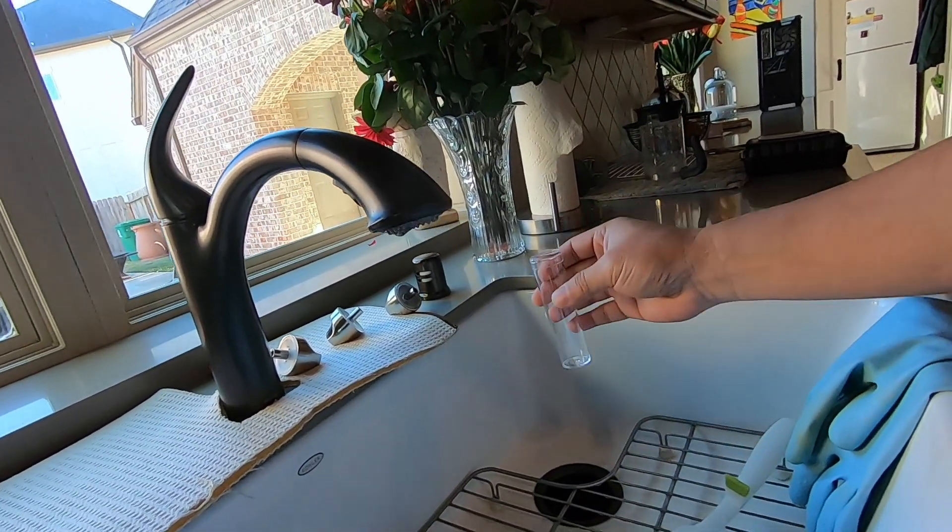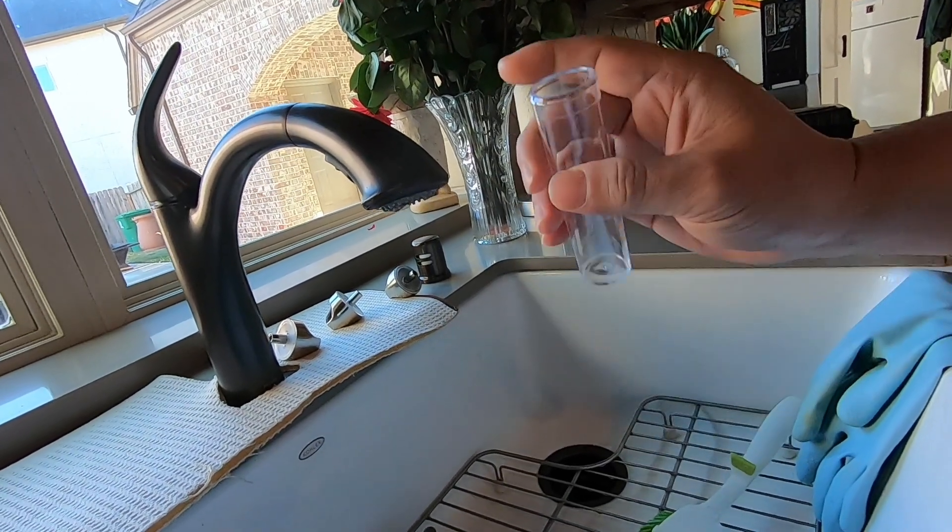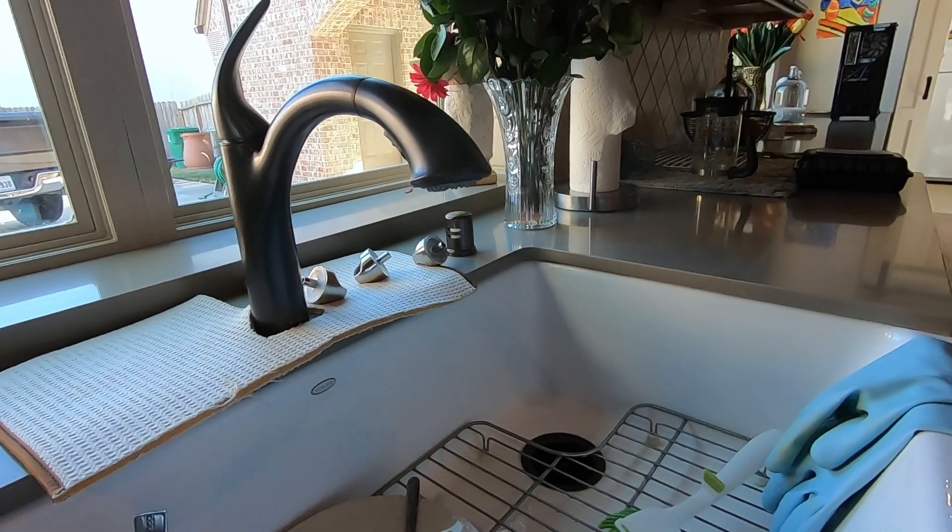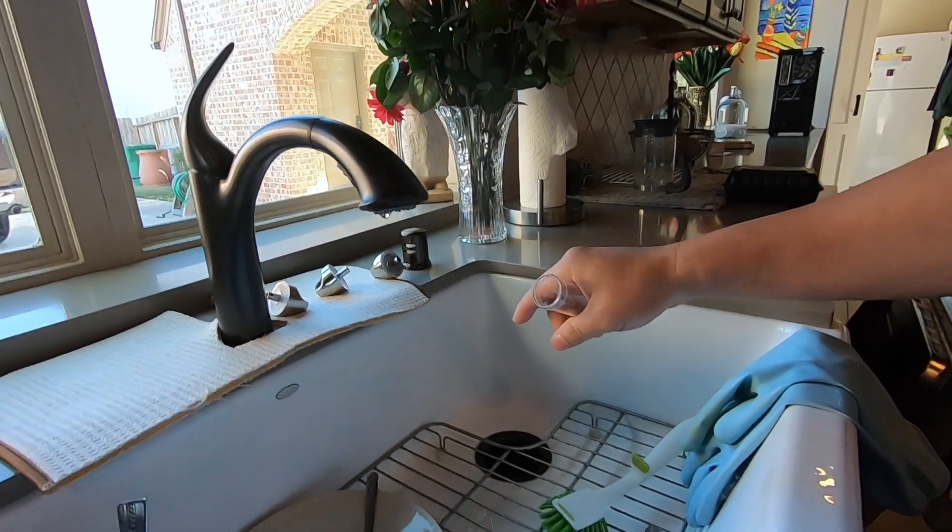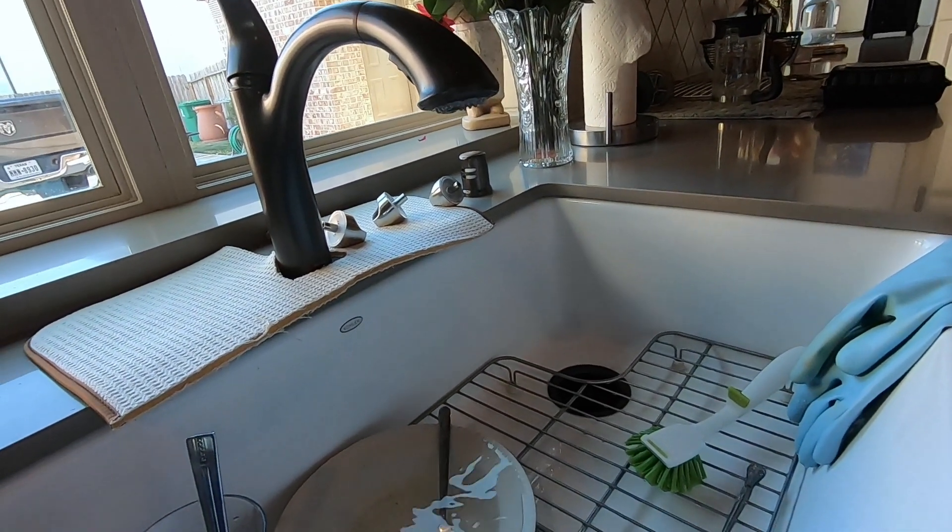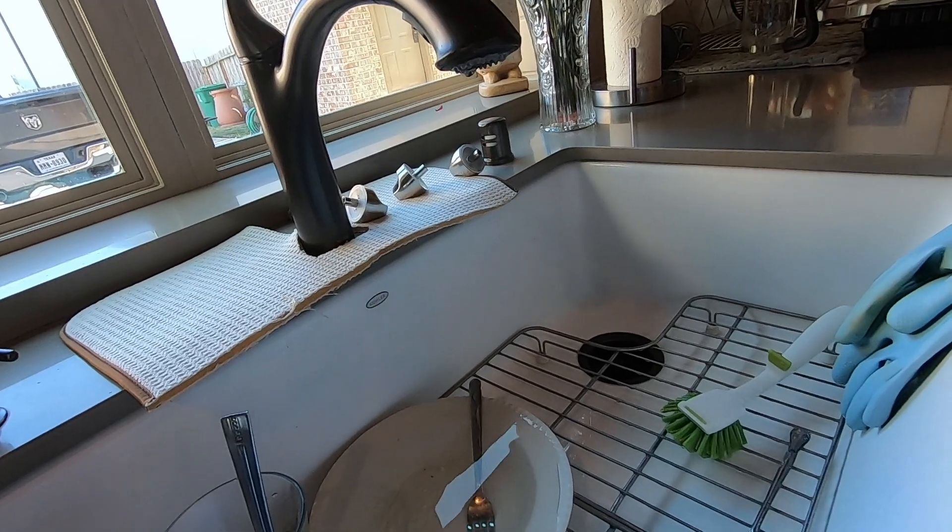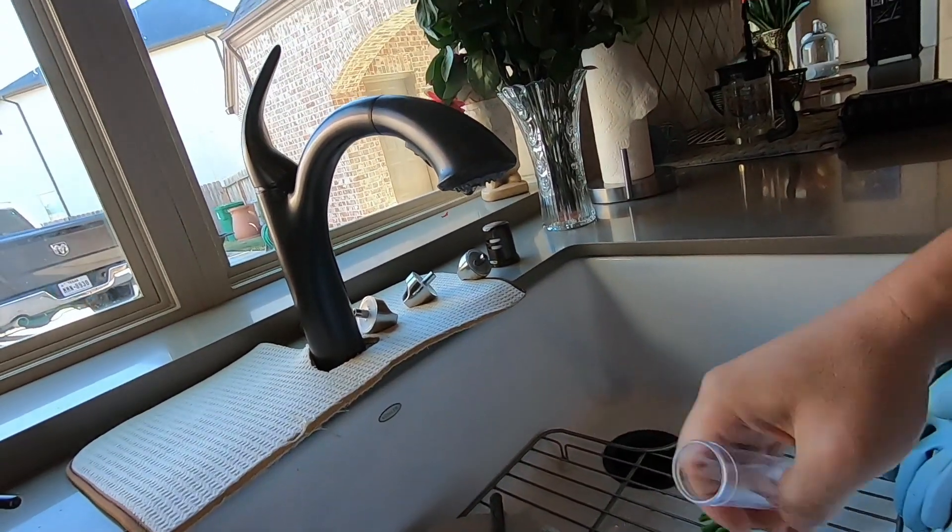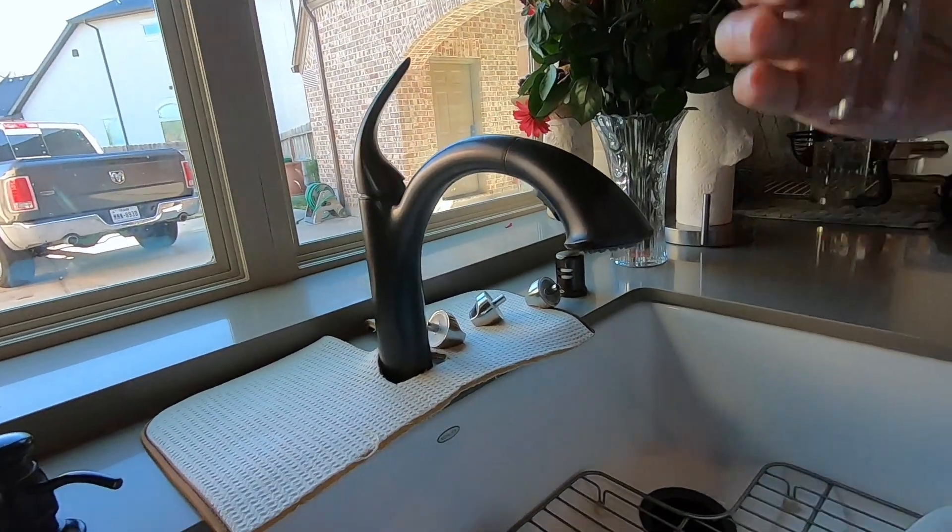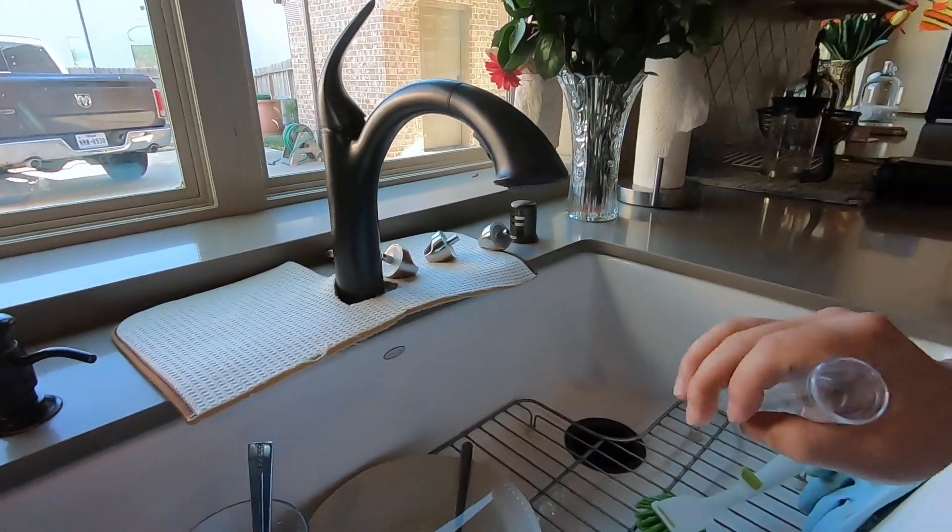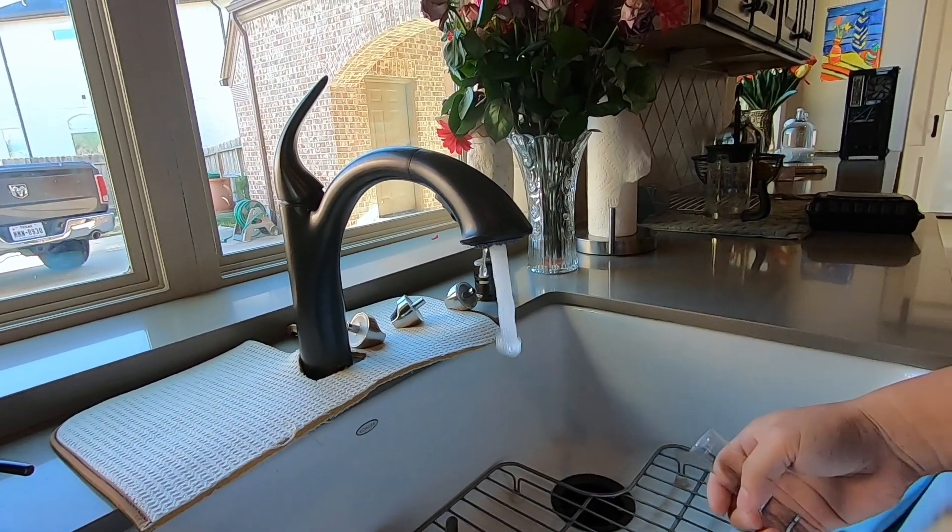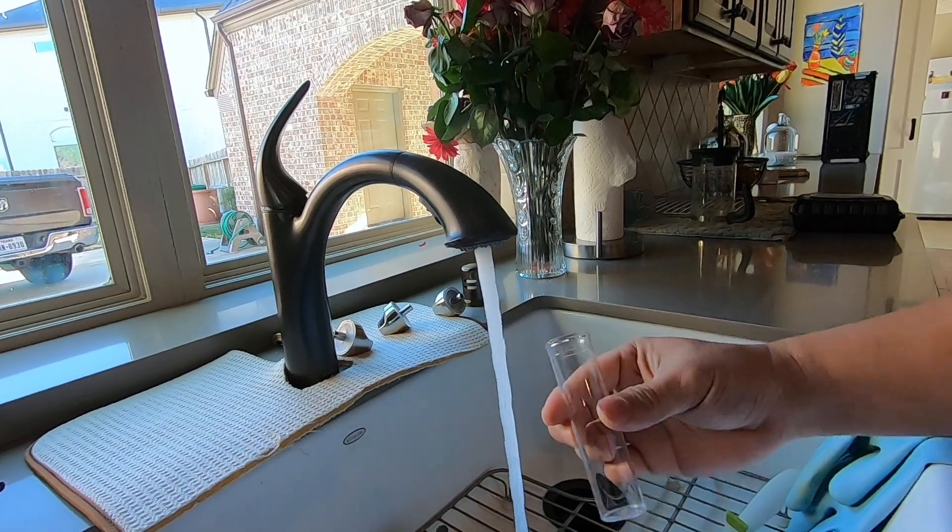Let's fill this up. One more thing, make sure that you run it for about maybe 30 seconds to a minute to clear out all the previous water that may be in the pipe. If you had this in hot water or somewhere in between, there are still water in the line that is not exactly 100% cold water. It may be a combination of hot and cold.